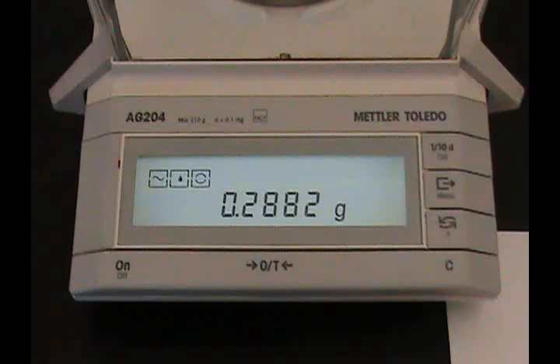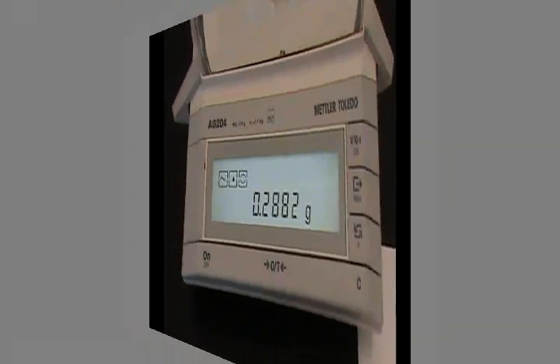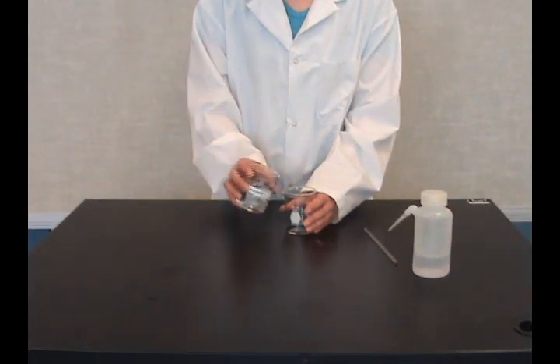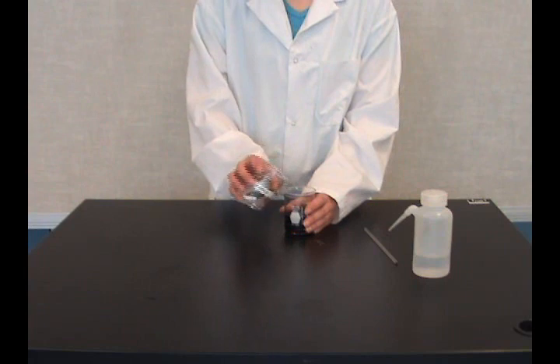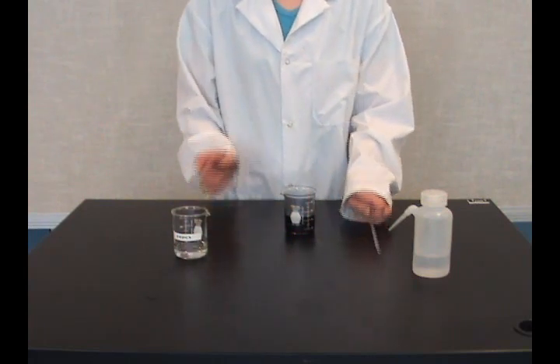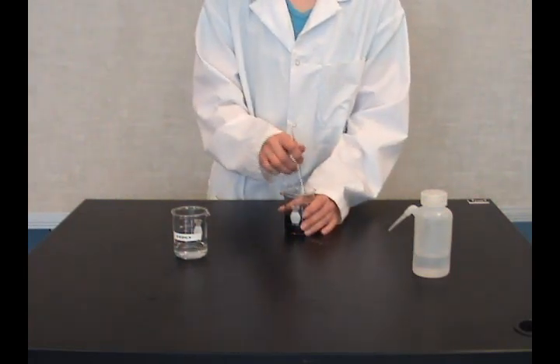Weigh out as closely as possible to the mass desired. Add enough distilled water to completely dissolve the crystals. Stir with a glass rod to help with the dissolving.